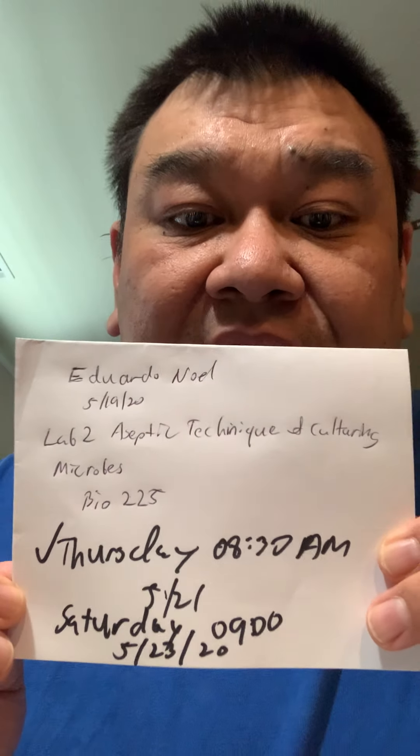Experiment two was very successful, and experiment three as well — the results were very successful. I like the outcome of this experiment; it made me understand, especially how I will need to relate it to COVID-19 and how bacteria can be spread so easily, especially aerosol. This is my video for experiment two, aseptic technique and cultured microbes for Bio 225. Thank you so much.